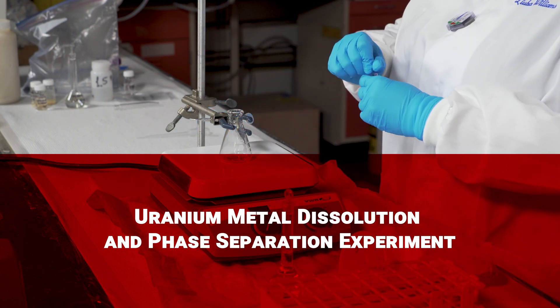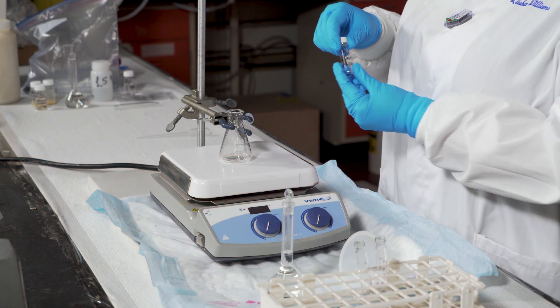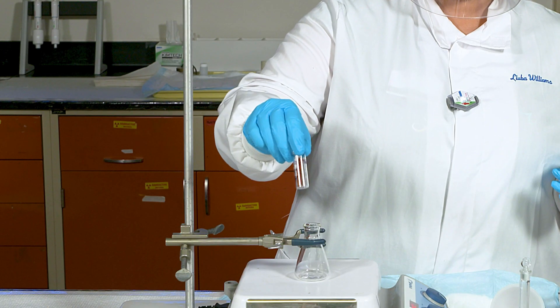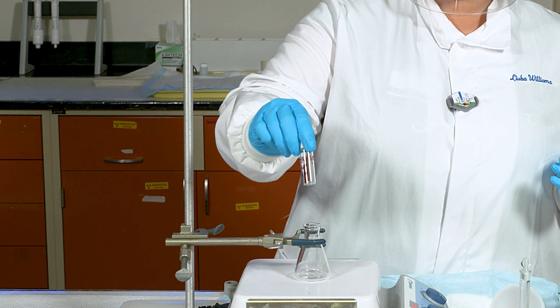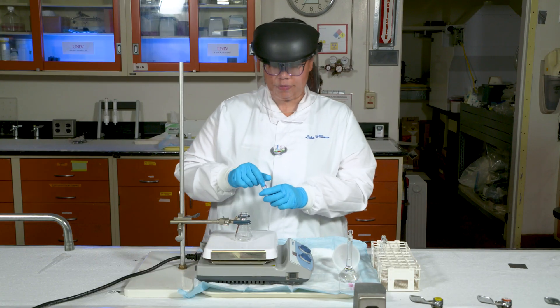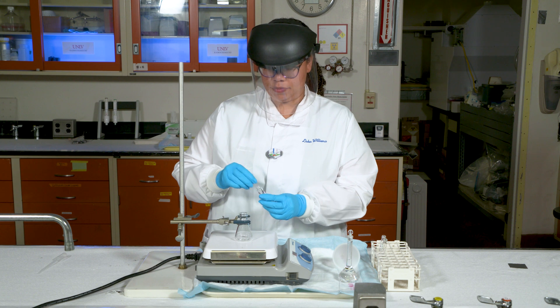Before beginning, we would like to note that the identity of the uranium sample used here is unknown. It is possibly uranium metal, uranium dioxide, or a combination of the two. The identity will be verified as the experiment progresses.